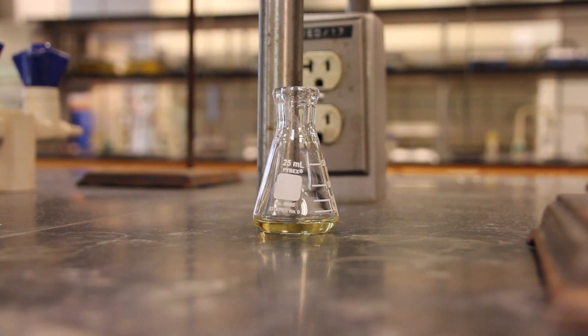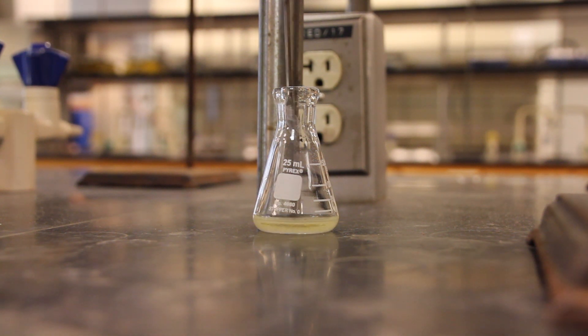As with all recrystallizations, you must avoid a large excess of solvent since this will not allow for crystallization to occur. Do not touch or move the Erlenmeyer until the solution is at room temperature.